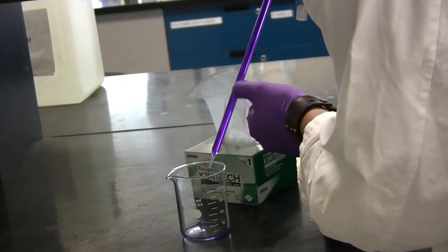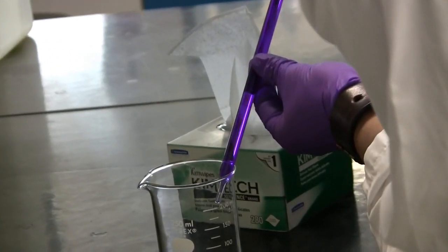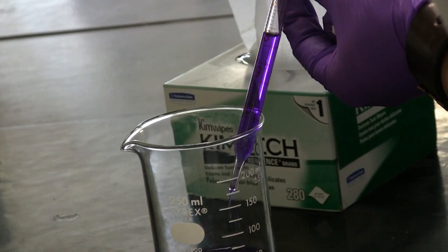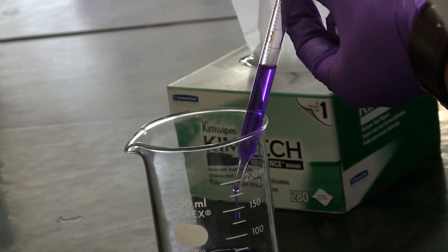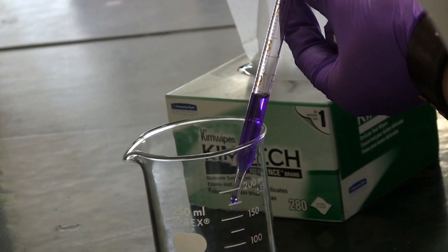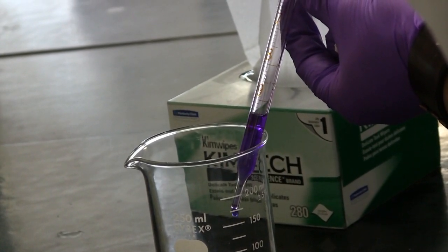Place it into your desired beaker and deposit the solution. Make sure to stop at exactly the 10 mL mark, as any below this is excess and needs to be discarded into a waste beaker.